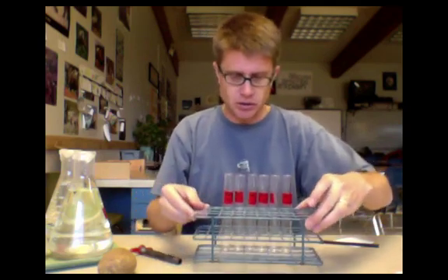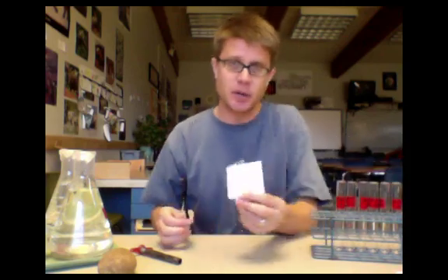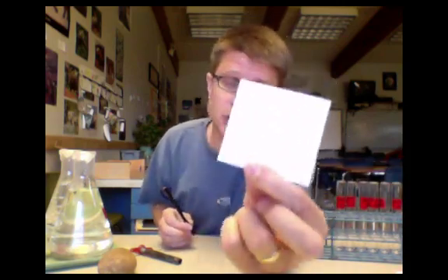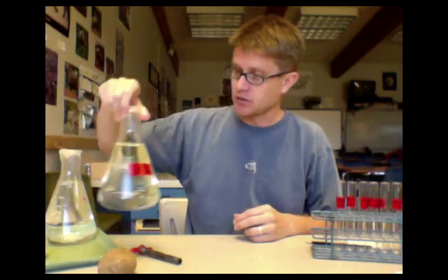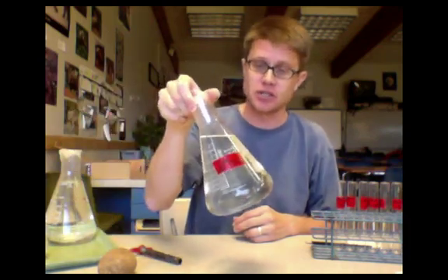Make sure you put your name on it. You also need a sheet of paper that's going to have your initial masses today. Then you'll need to share, I've made a bunch of sucrose solution for the class.